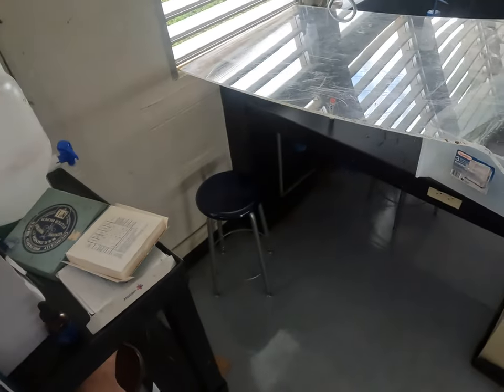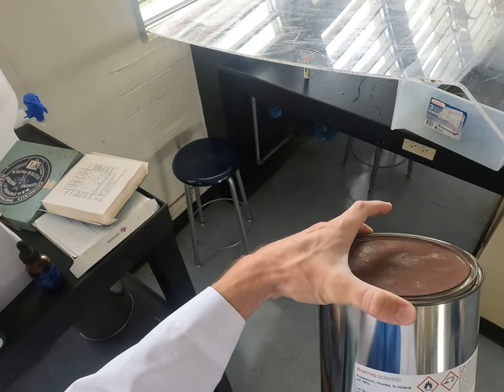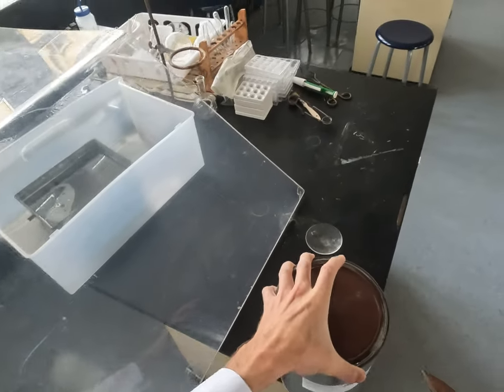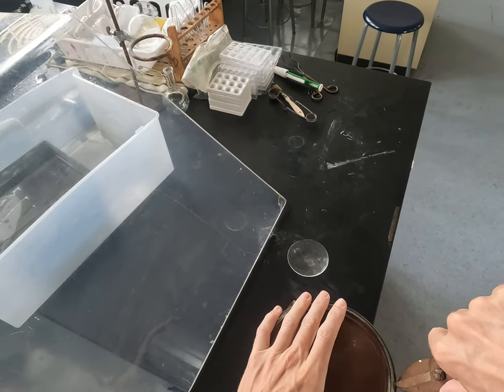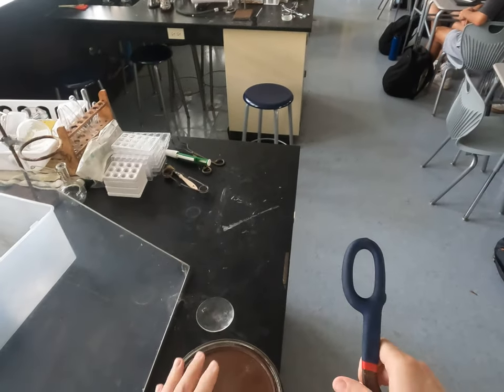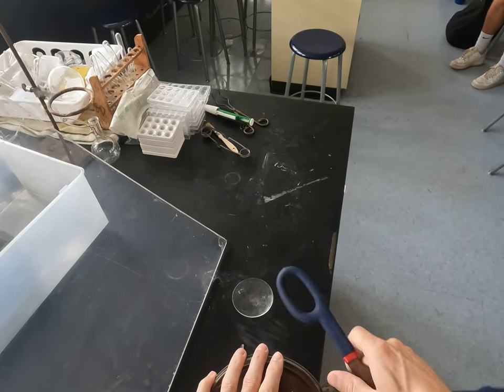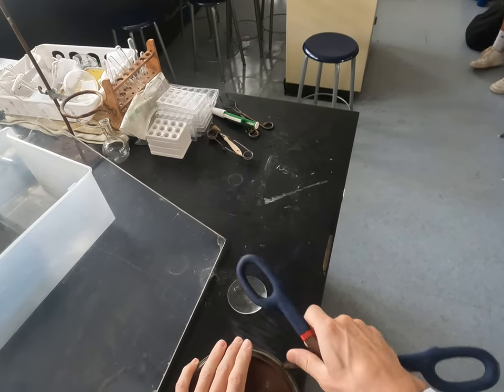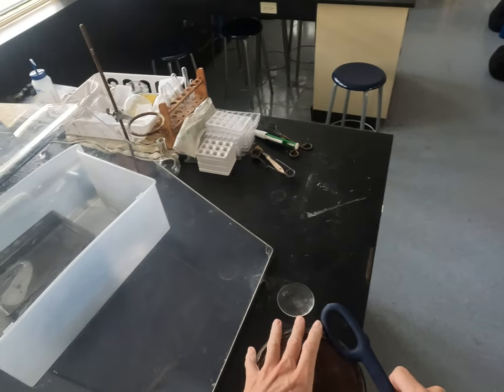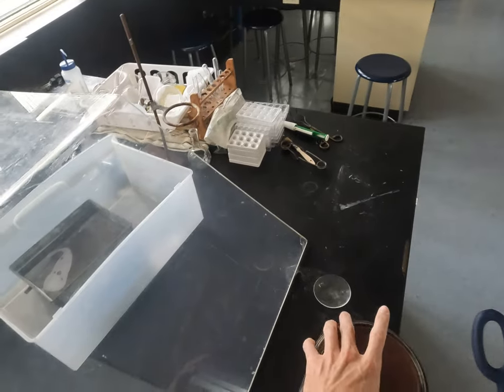Okay, so now I'm recording. I have here — this is labeled potassium chunks in mineral oil. I want everyone to be able to tell me, like we've been talking about different reaction types, right? So we're going to do a reaction.